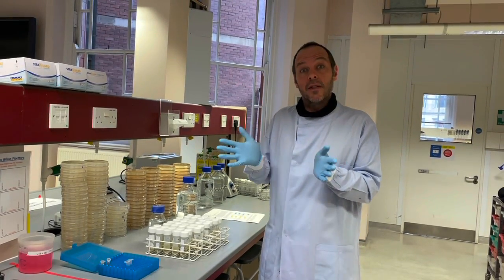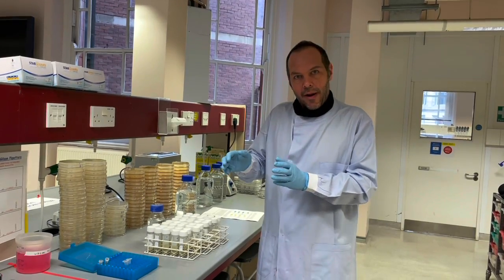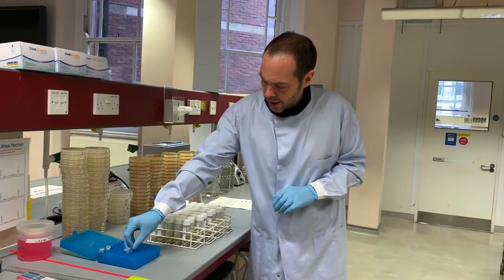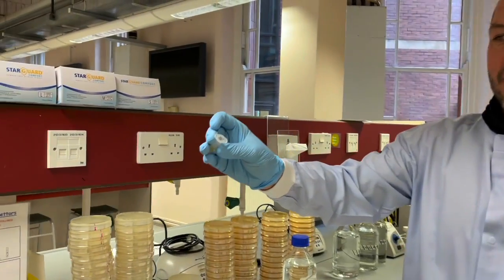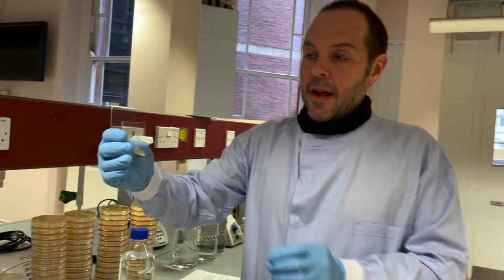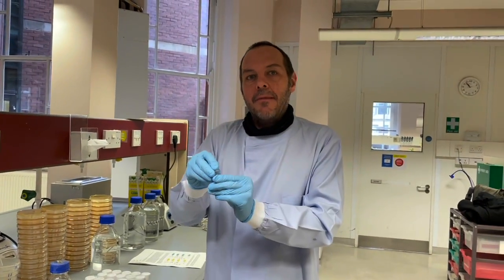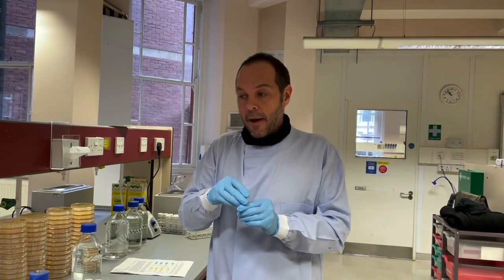I've mixed 2 yeast strains together, and I mixed them really well, and then from that mixture I've taken samples which are in these tubes. Normally we'd have 16 of these, one for each of you. But these came from the same mixture, and there are millions and millions of cells in here, actually about 10 to the 8 cells per milliliter.